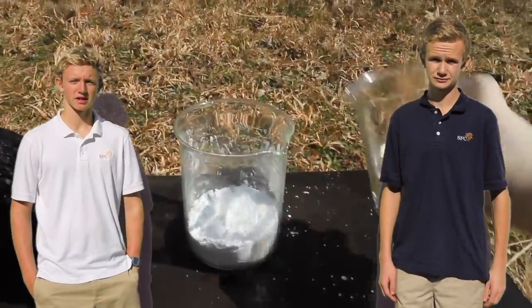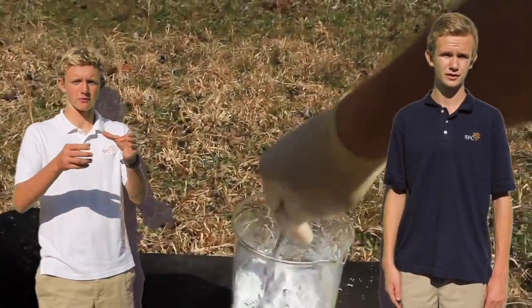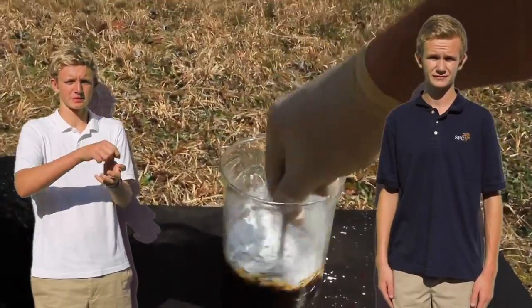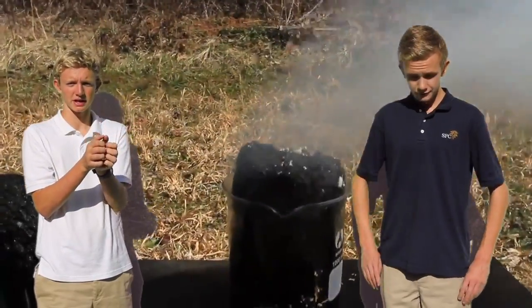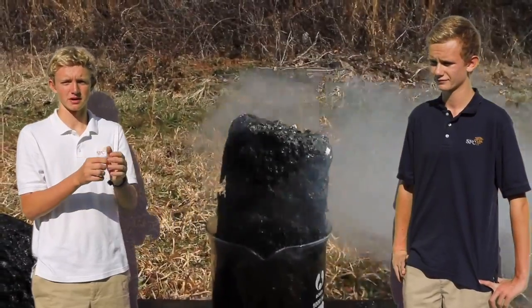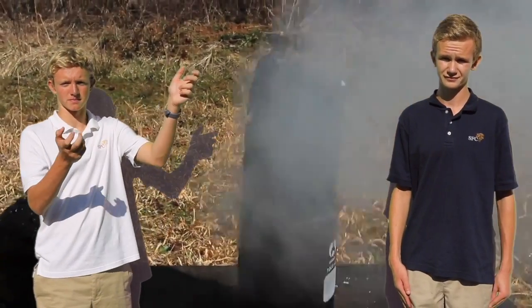So basically how it works on a macro level, a general idea of how it works is, like I said before, you pour the acid into the beaker full of sugar, and it takes a little bit of time to react because you use a stirring rod, but then it separates the sugar molecule into what it's made out of. We'll get to that soon, and then the carbon becomes separated, and it forms this big black column.